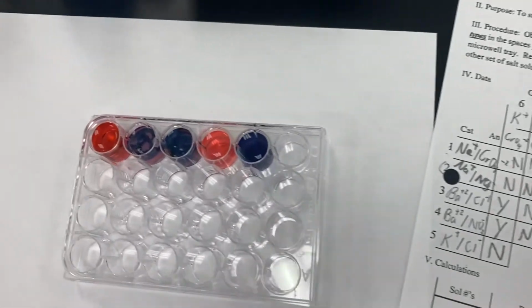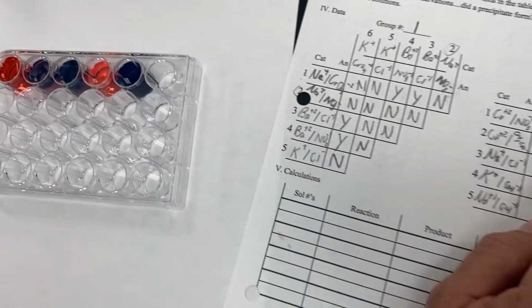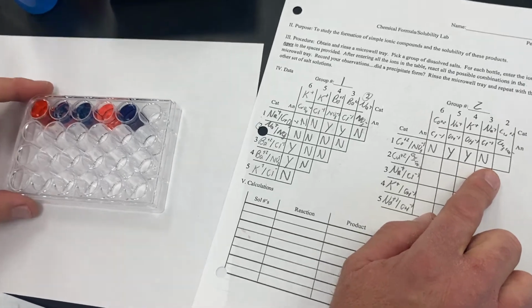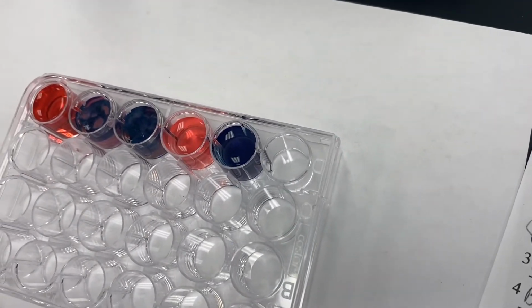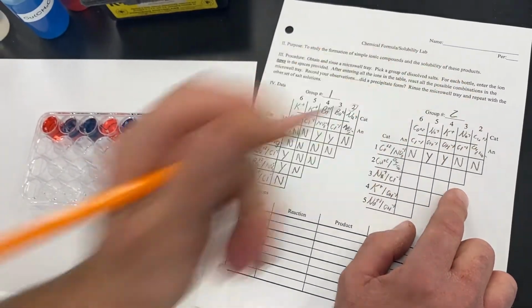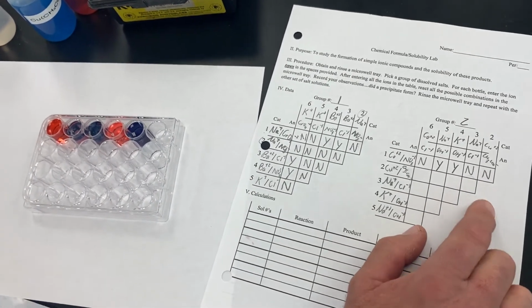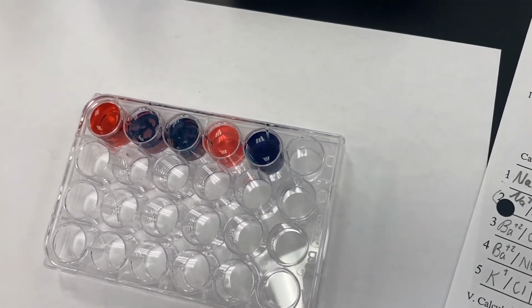And you'll notice that this is purple in color because of the combination of the red and the blue, but there is not a precipitate in this one. I don't know if that comes through, it's kind of hard to tell. Yeah, so this did not precipitate. The color that we see there is just a mixing together of the blue and the pink, creating purple, but there is not a precipitate that formed there. You can kind of see it in the comparison between the others that formed the precipitate.